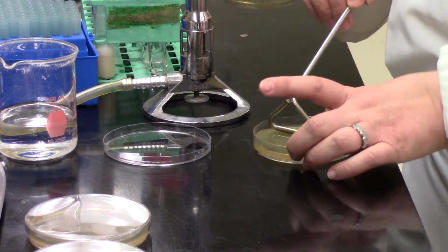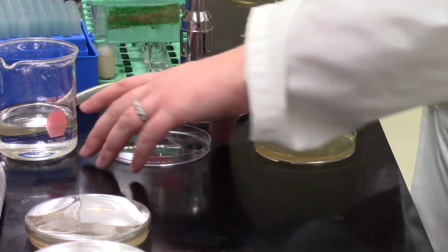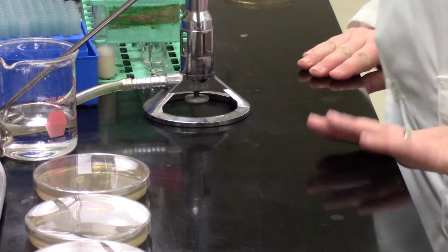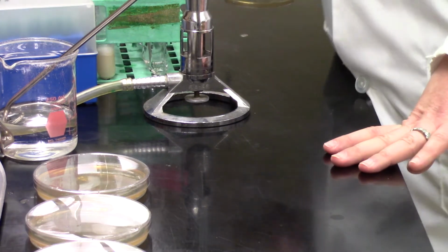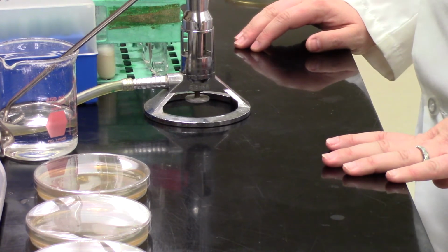Sabrina's just doing her final round around the outside with the plate. Lid back on. Into the 70% ethanol, and for now, we're going to close up the pipette. Obviously, you'd go all the way to the end of your dilution series before you would turn things off, but for now, we're going to show you just turning it off.